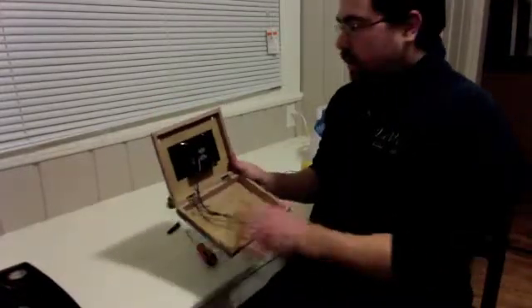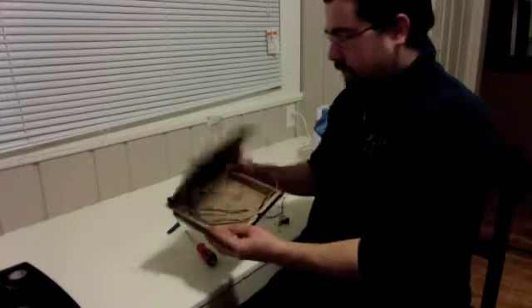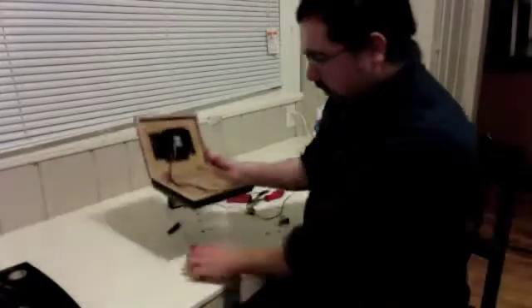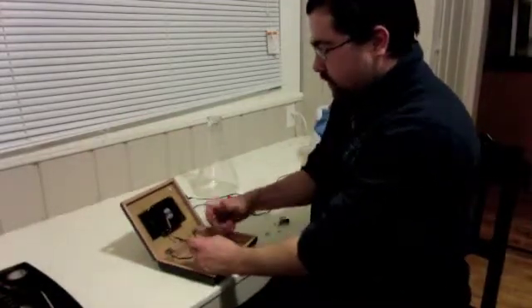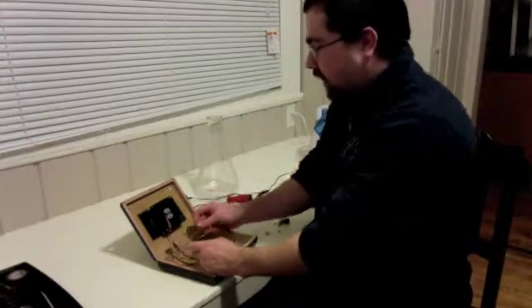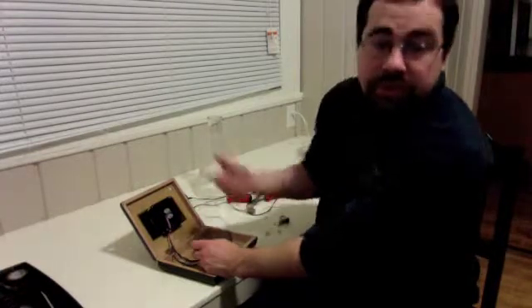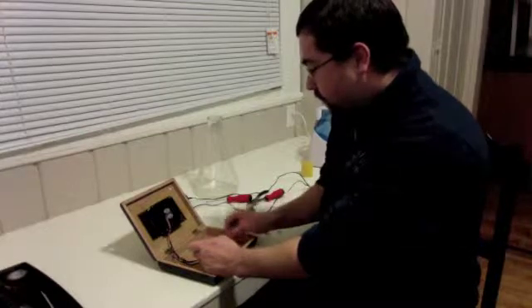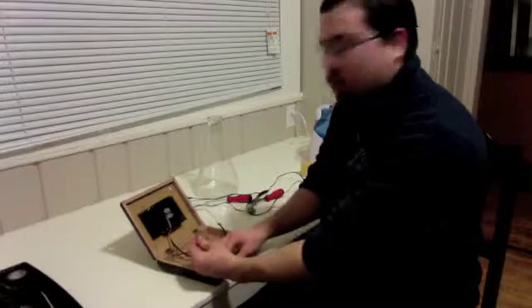And go. Alright, so now I got the fan mounted up underneath the hood here, so that won't move anywhere. And now for the simplest version of a stir plate, all you're going to end up doing is just wiring these together. And I said the black is the ground. The black you're going to just end up wrapping around one of the bolts that you use to screw in the fan and hold that into place. The other two are going to end up getting wired directly to the cord.